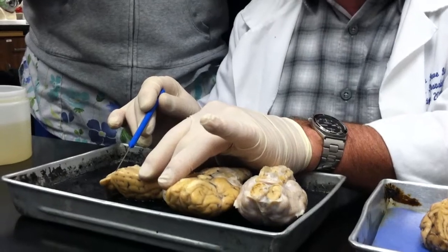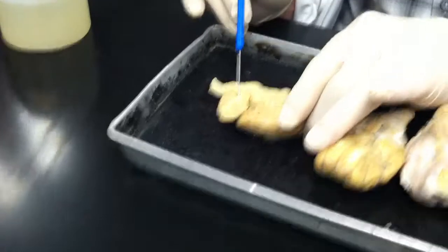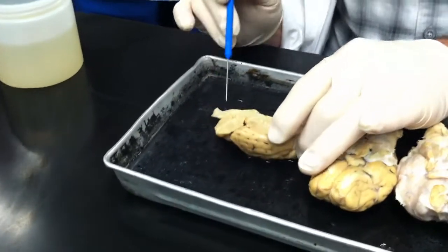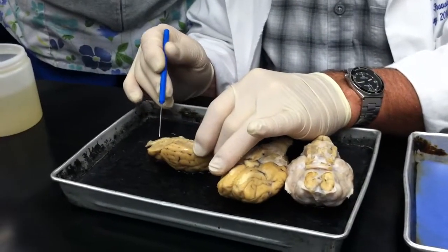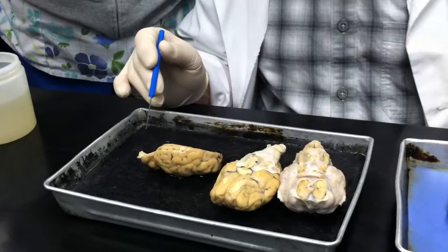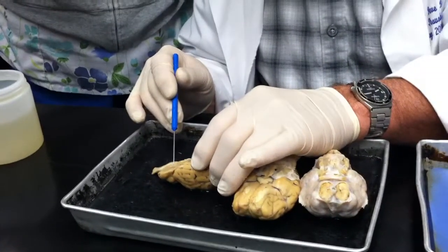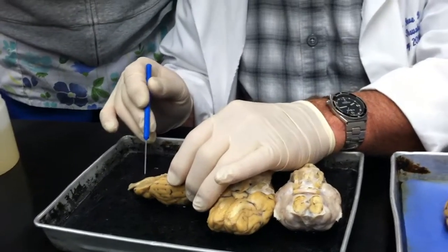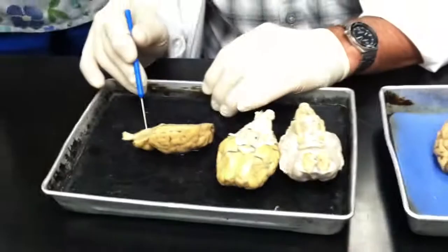The tree of life. You can see it there, right? All those little branches and things. I think it's a pretty cool name, right? So, tree of life. You can see right at the base of this it has gotten a little funky here, right here at the base of the cerebellum. You can see that. Anyway, there's a little hole, kind of a gap, right there. That's the fourth ventricle, right at the base of the cerebellum.